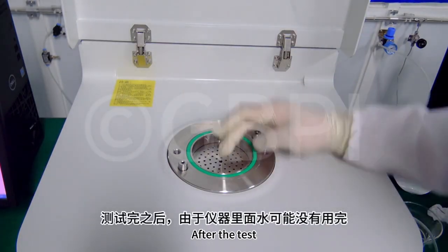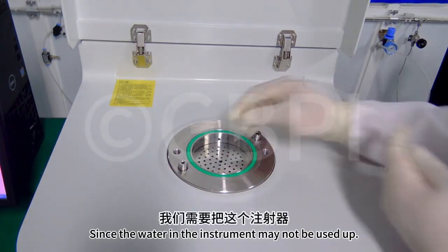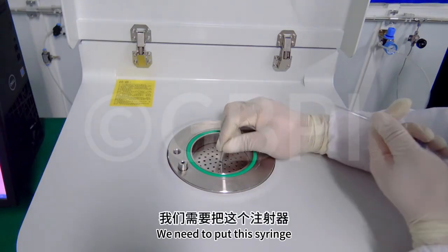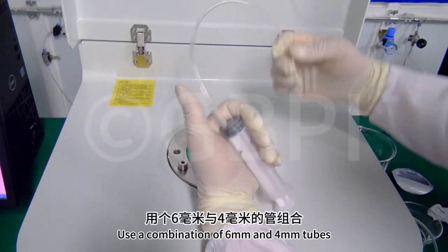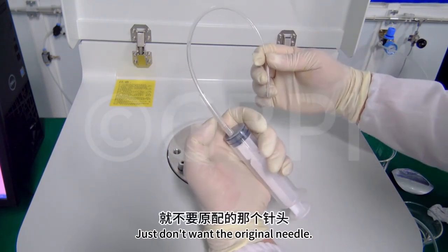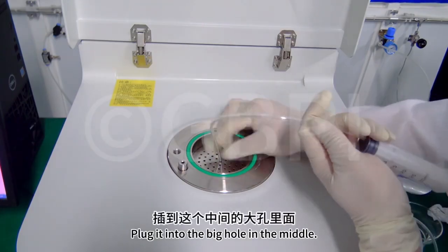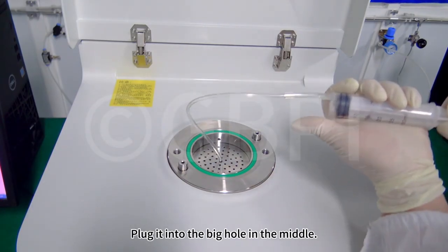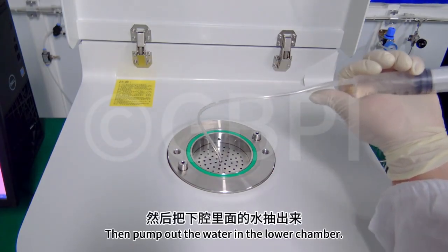After the test, since the water in the instrument may not be used up, we need to use this syringe. We can do it like this. Use a combination of 6mm and 4mm tubes. Just don't use the original needle. Plug it into the big hole in the middle. Then pump out the water in the lower chamber.